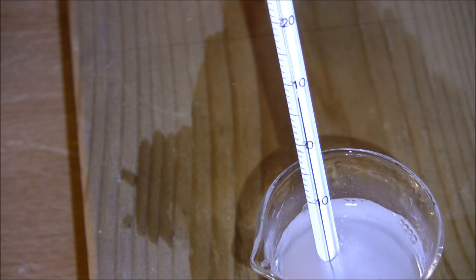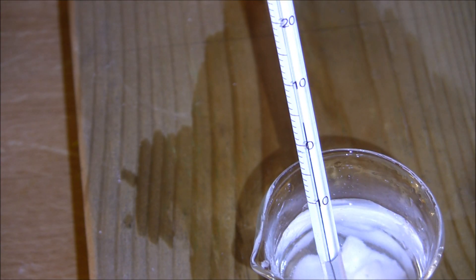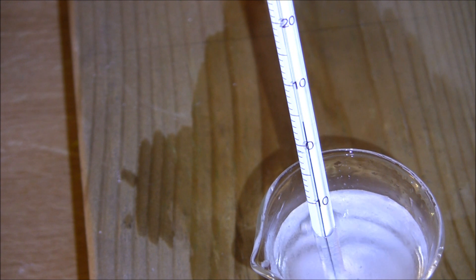And as you can see here, when the ammonium chloride dissolves in the water, the temperature drops until it reaches zero degrees centigrade.